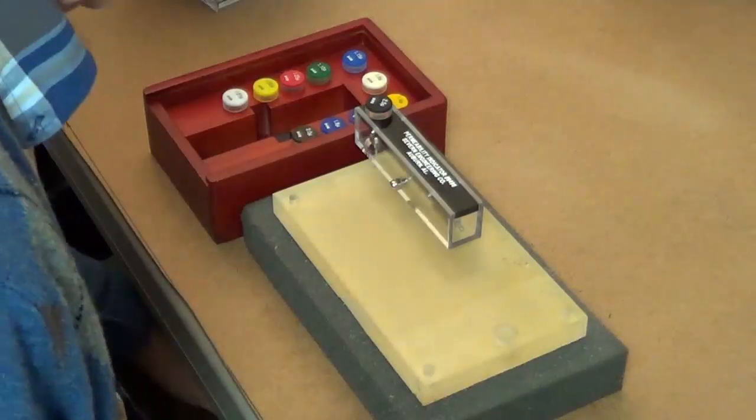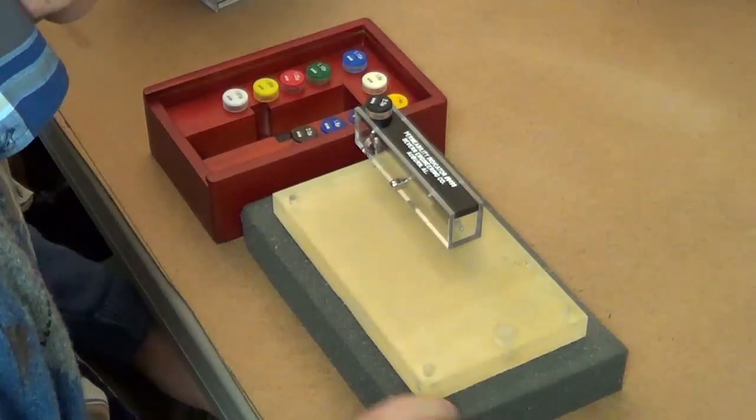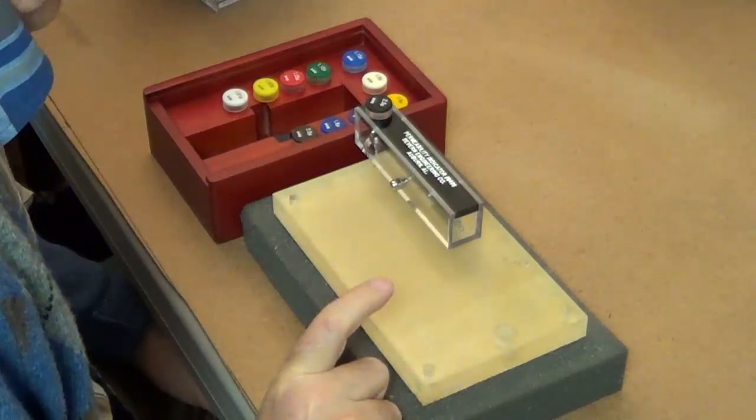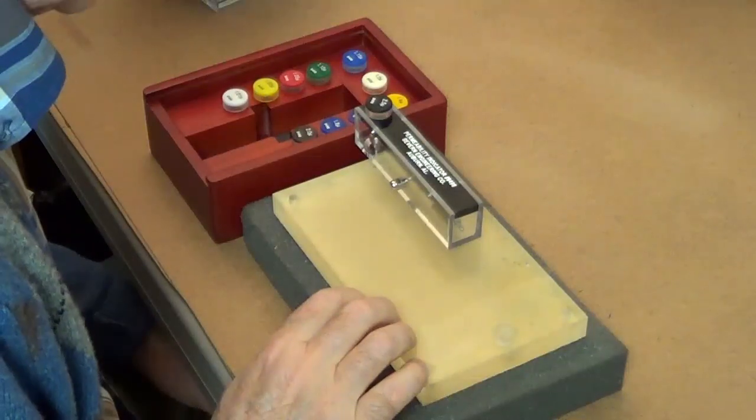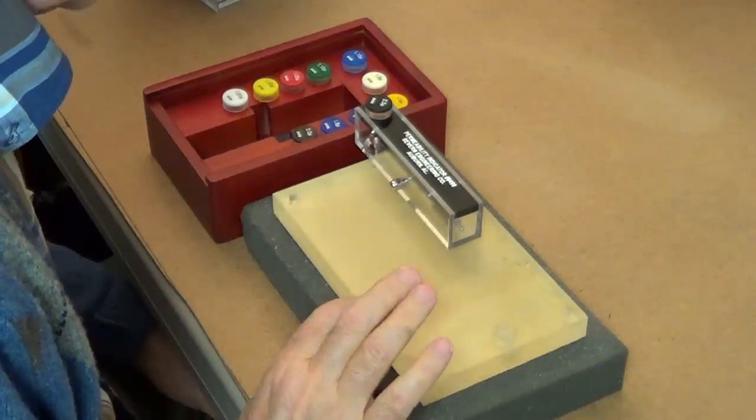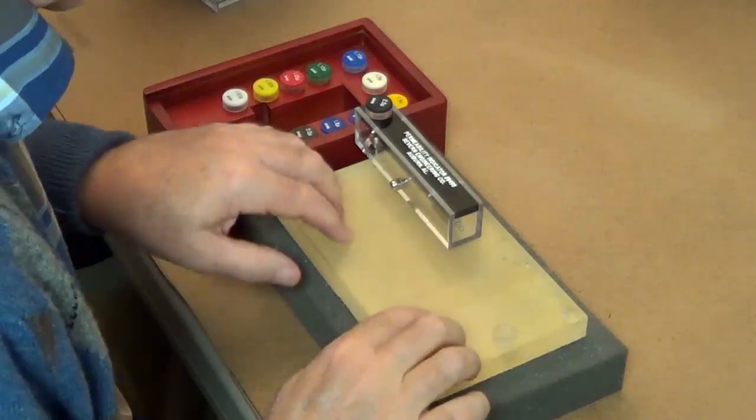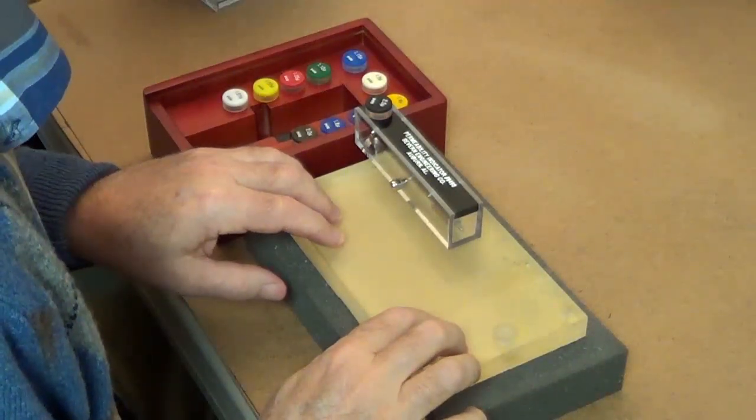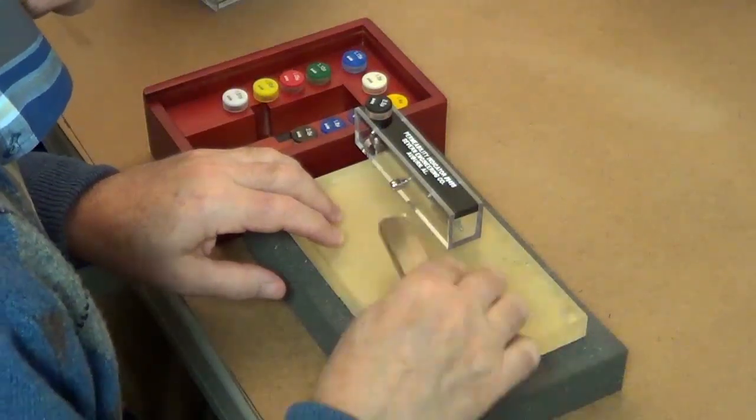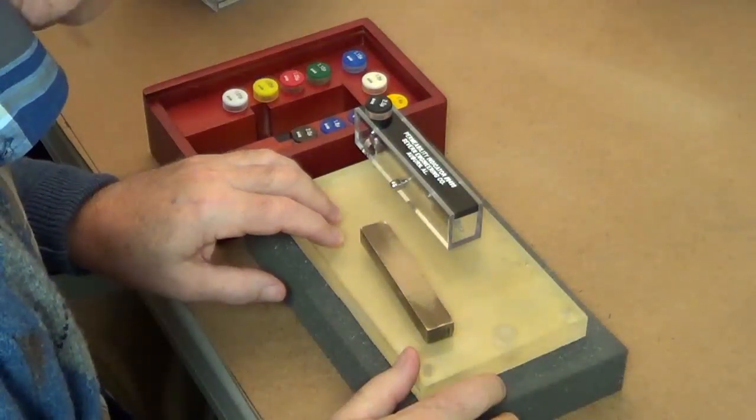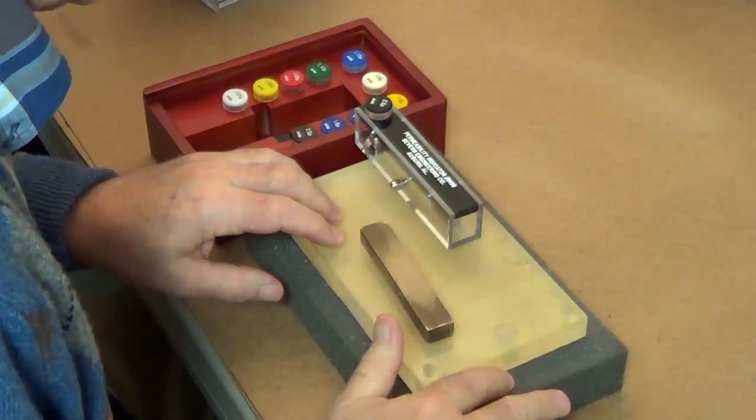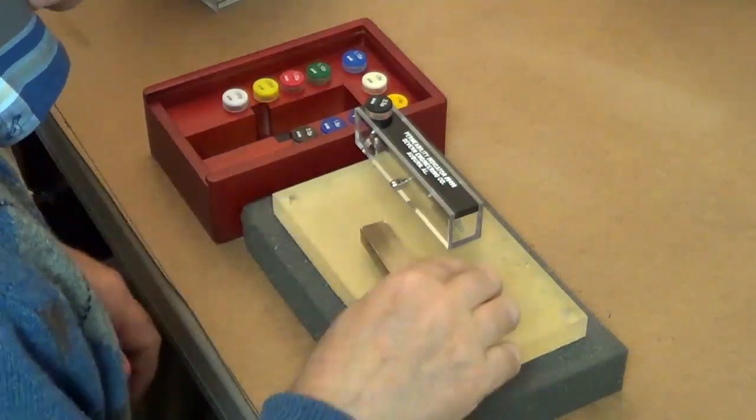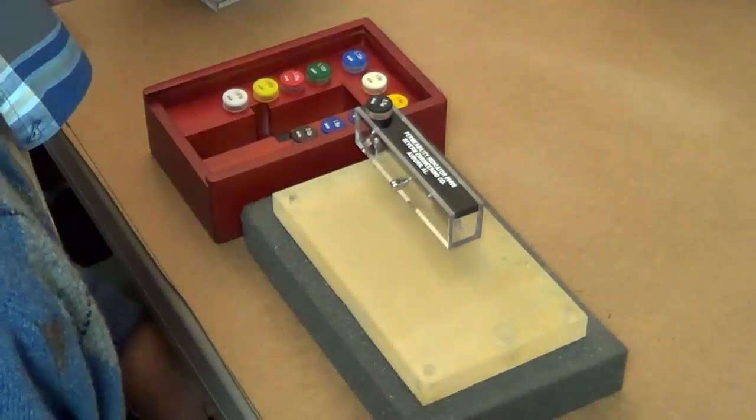If you have to use a metallic table to do the testing on, then I would suggest that you make sure that the distance between the table surface and the test surface that you're using is at least three inches. Now I've selected an acrylic sheet or acrylic layer here to use because it's nice and hard and you do want a nice hard surface to put your sample on. The rigid foam, although it's quite rigid, is still not hard enough to actually do the testing. So I use an acrylic plastic material.